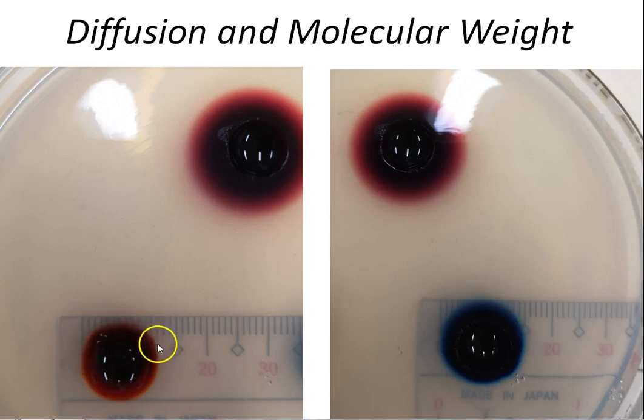More or less, this is the edge, this is the other end of our diameter, the other edge of our diameter. How big is the diameter of the diffusion of your Congo red?